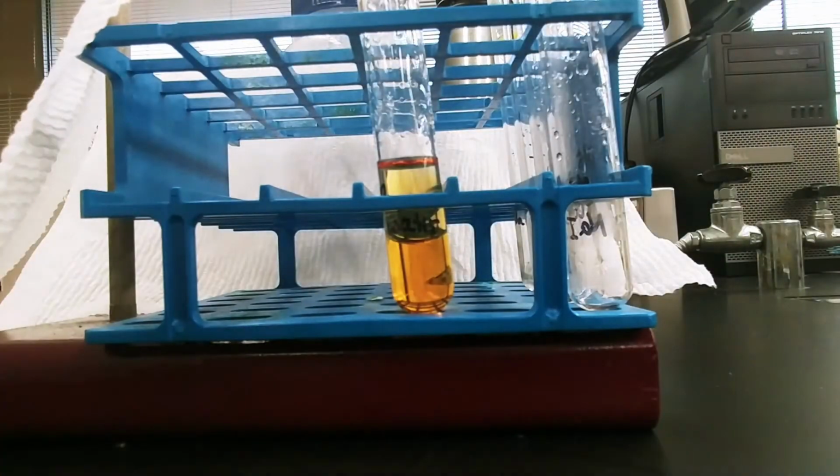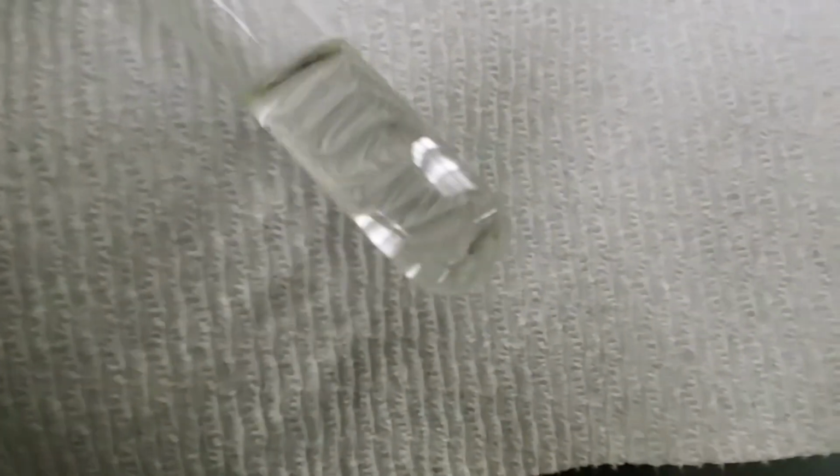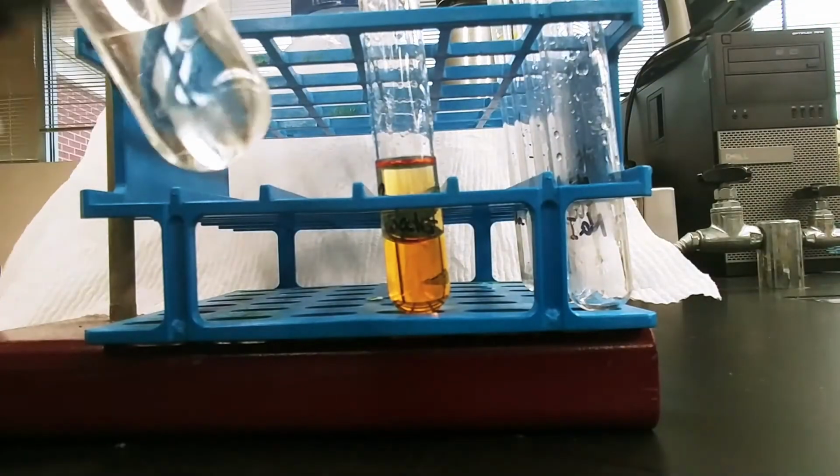Maybe hard to see against a white background, but let me erase some of the markings on here. So I've erased some of the markings on test tube number 1 to make it a little bit easier to see that double layer. Both these solutions are relatively clear, so it's going to be tricky to see that second layer. I'll try it with my glove, since it's flat. It'll be easier to see. So there's a second layer. There's 2 layers in this test tube.